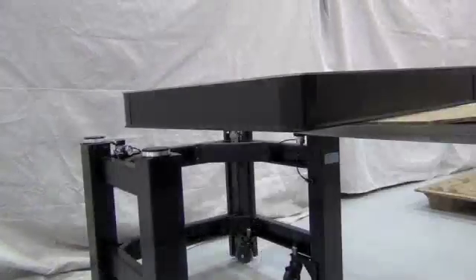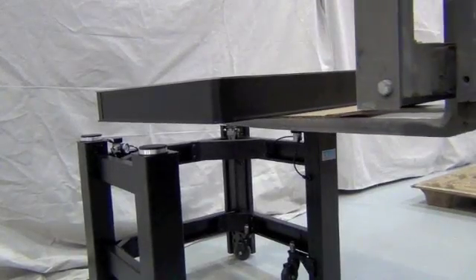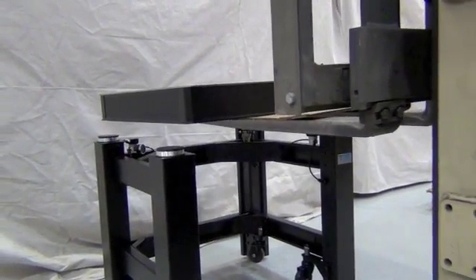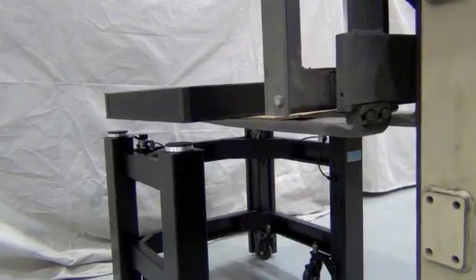With the top safely positioned on the legs, it will need to be centered. A tape measure will be useful here. This is the end of the heavy lifting.